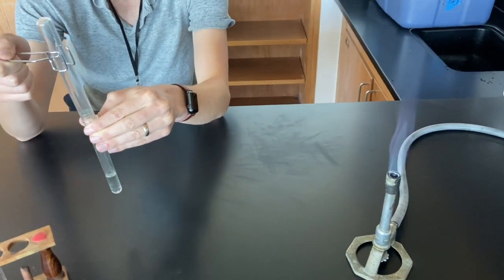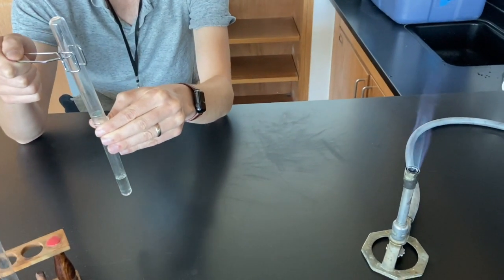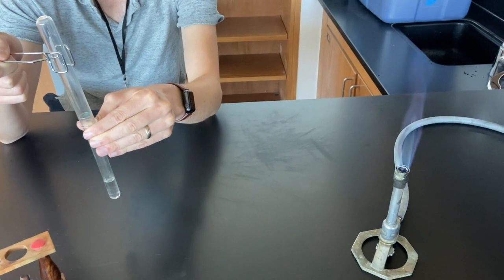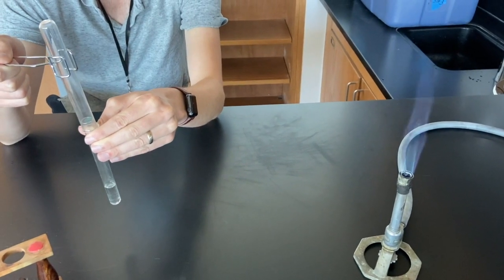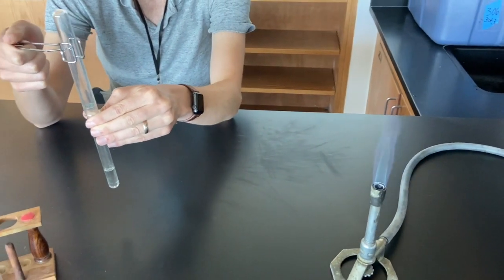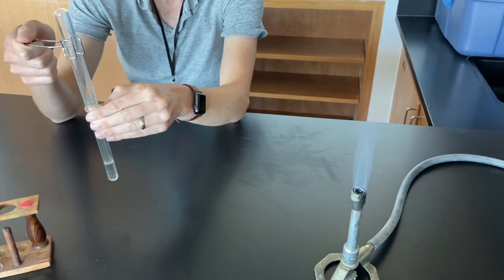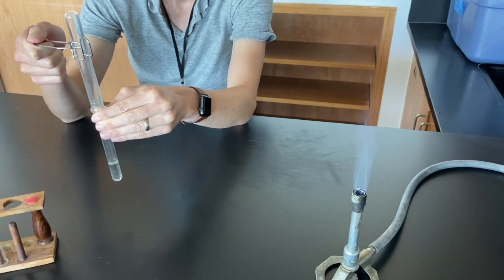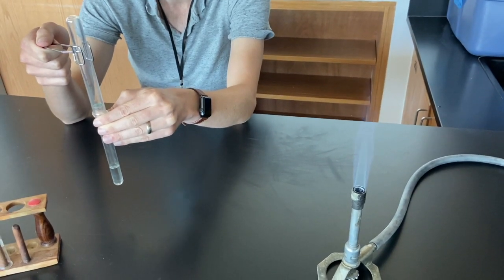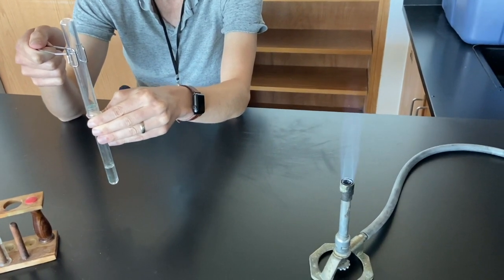So this is the next demo. What I'm going to do is take the gas that was just collected from the previous one and move it over the flame. Your before observations are the gas that you see in this top test tube.